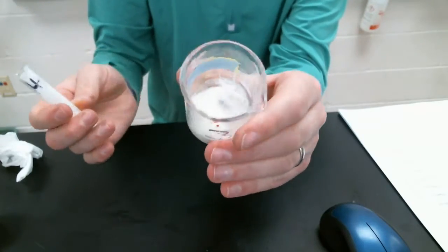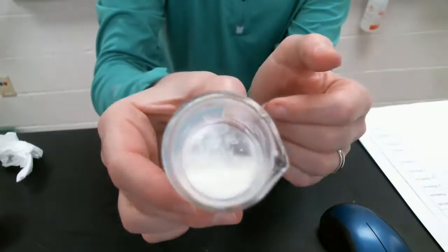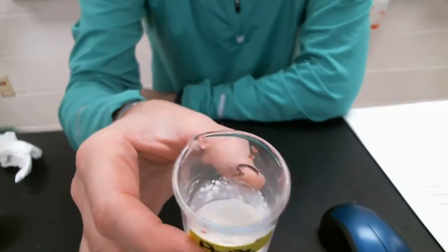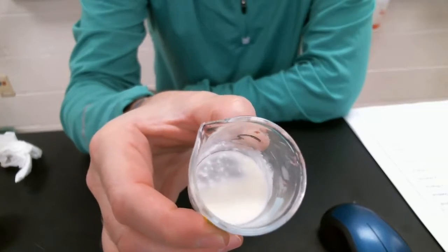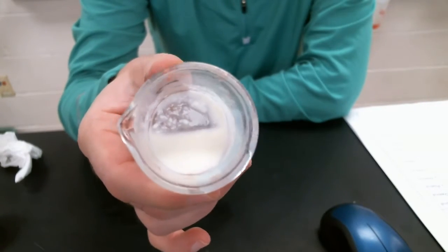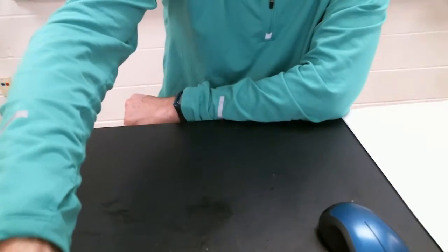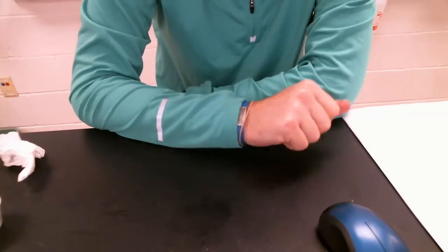So now, again, kind of hard to see, but now instead of being all liquid, it's a little chunky. And it's actually giving off a really bad smell. So now that milk kind of turned chunky. You got a really bad smell that's being given off. Kind of see some of those chunks in the bottom of the test tube there. So what do we think? Physical or chemical? Chemical would be correct. We denatured the proteins in milk by adding the acid, which is a chemical change.